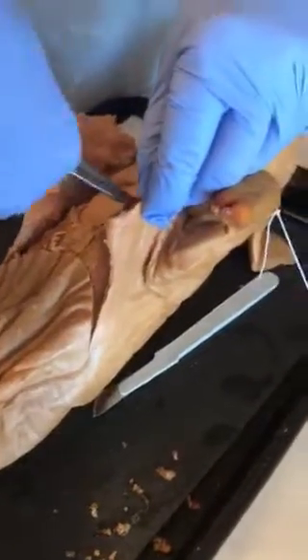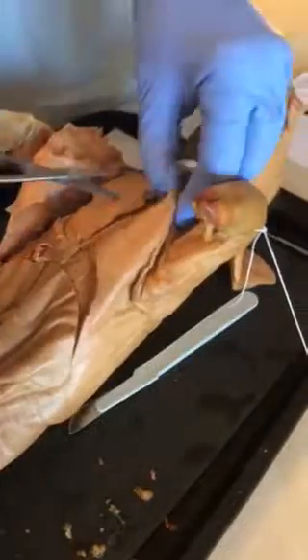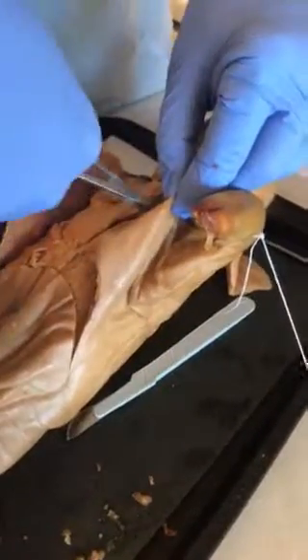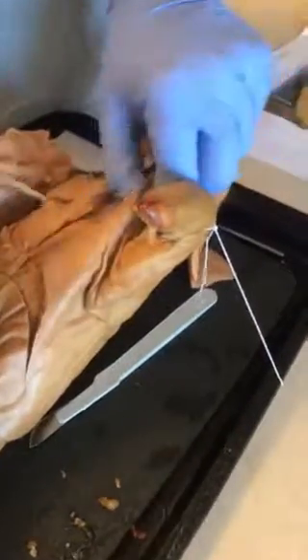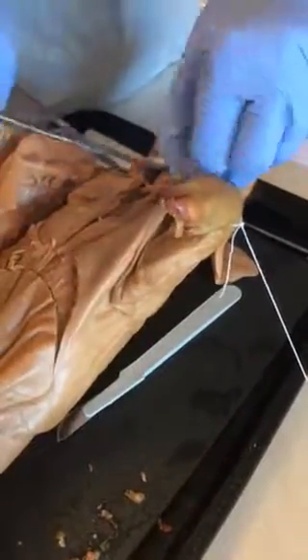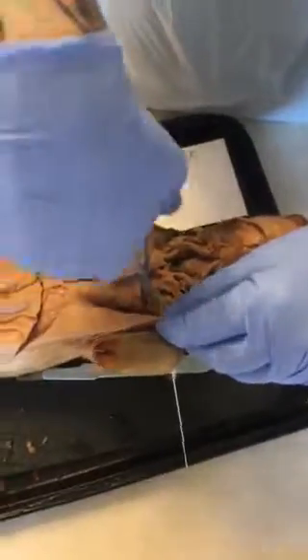With the scissors, using them. Some parts I can tell the connective tissue from the muscle fiber, so it's easy, I can just snip it, but on some of them I have to use the separating trick on the scissors so that we don't go too far. If this pig was alive, I'm pretty sure he'd be in bad hands.